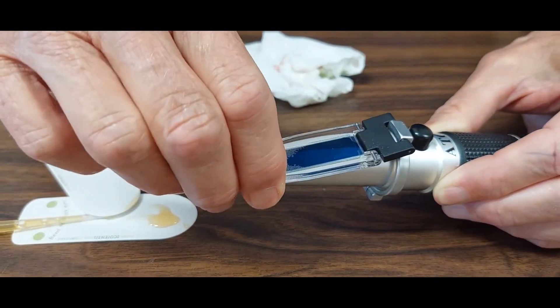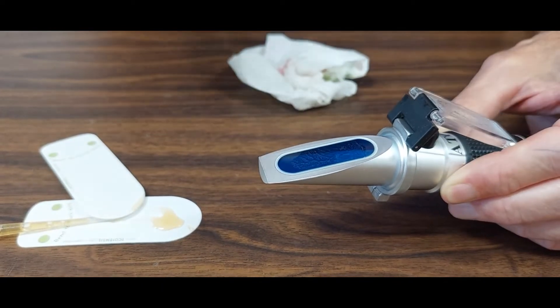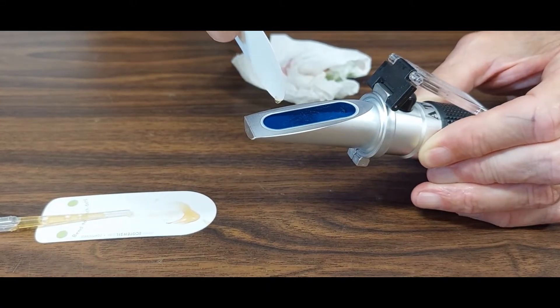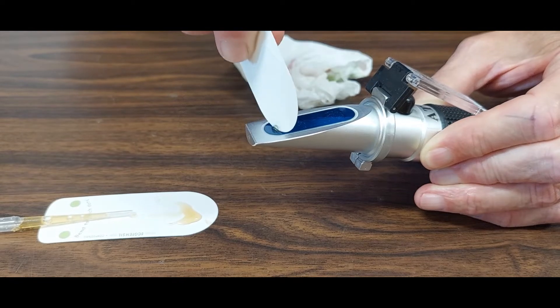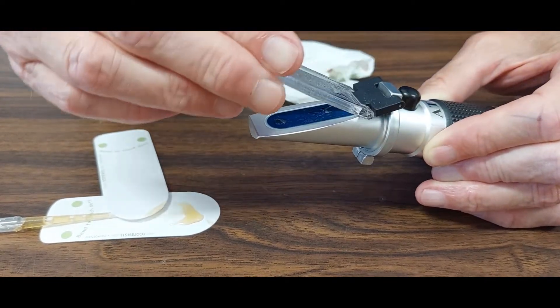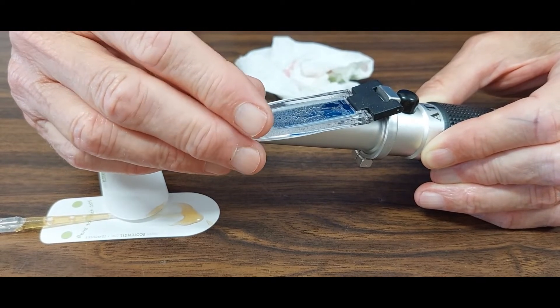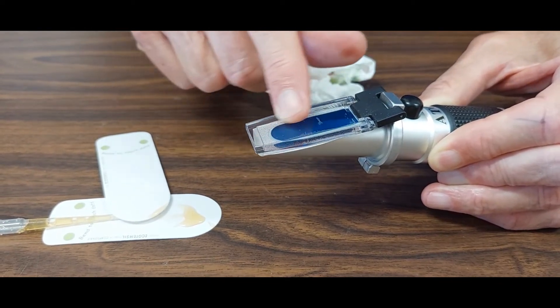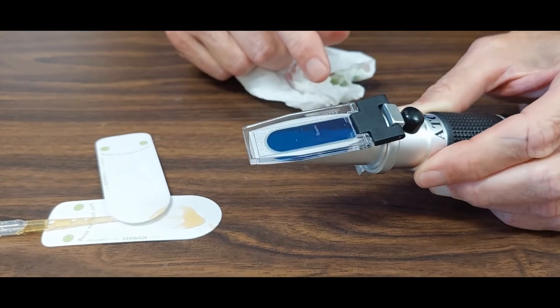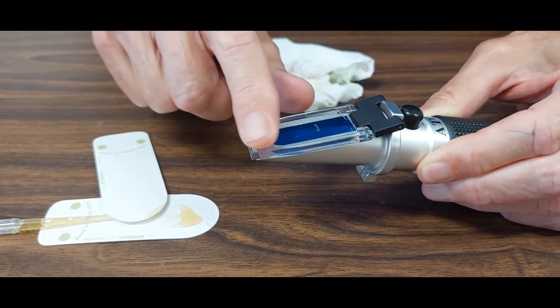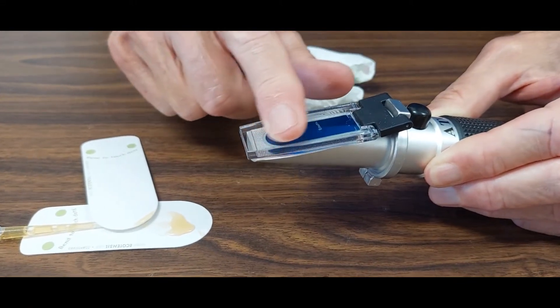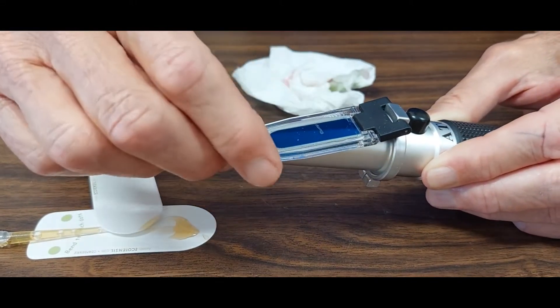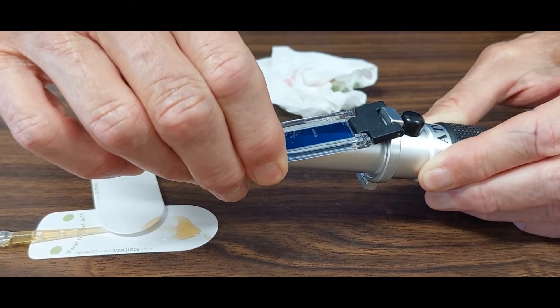So, I'm going to need to add a little bit more. Better to add smaller amounts and work up than to go the other way around. You really can't press too hard. I've got some bubbles in there. I've got to work those out.